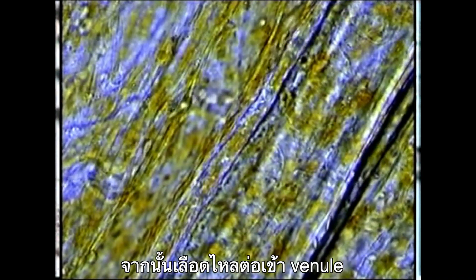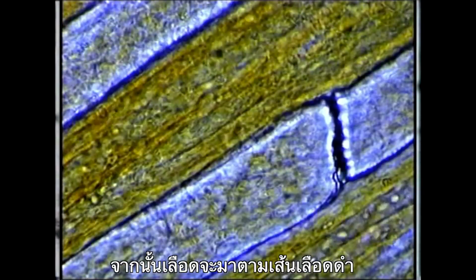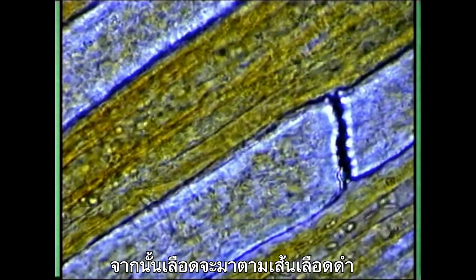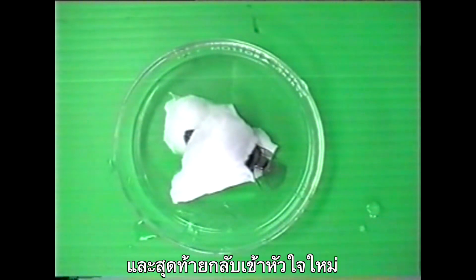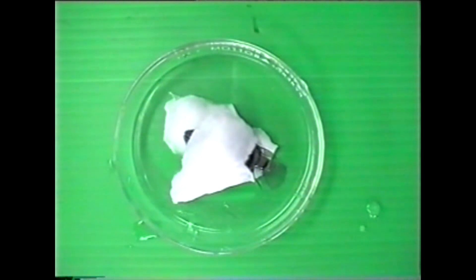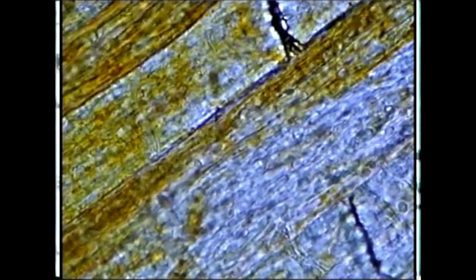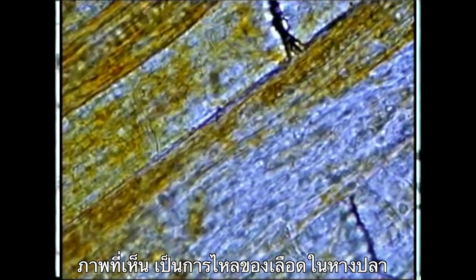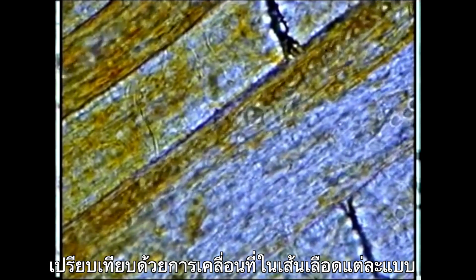Finally, blood flows into the venules, which carry the blood into larger veins and eventually back to the heart. You should be able to see the movement of red blood cells in the three types of vessels. Notice the different blood flow rates among the three types of vessels.